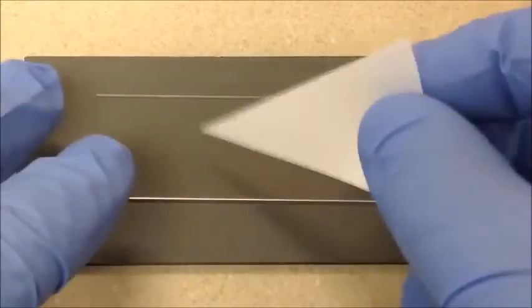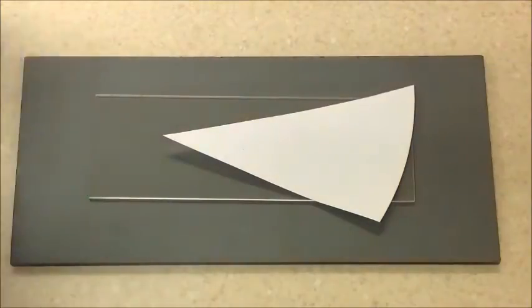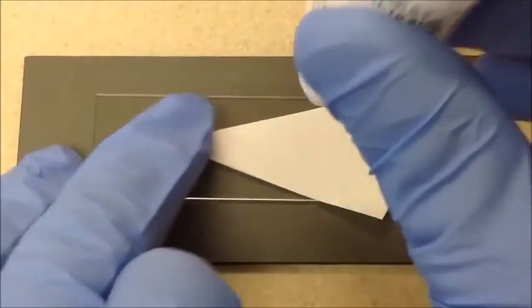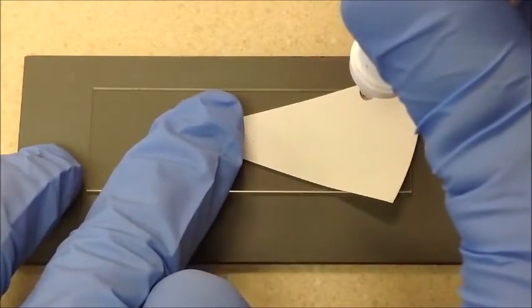It's also routinely used in the workup for Neisseria and Moraxella species. To run this test, it's pretty simple. It's a rapid test. We're just going to take a piece of filter paper and put it on a regular slide, nothing special about it. I just cut that filter paper up and take one drop of reagent and drop it on there.